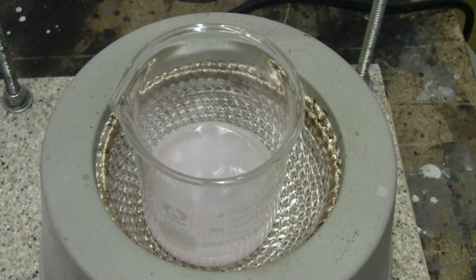I'm now heating and stirring the ASA solution in the beaker. When it gets up to temperature, I'll start adding the copper carbonate bit by bit.